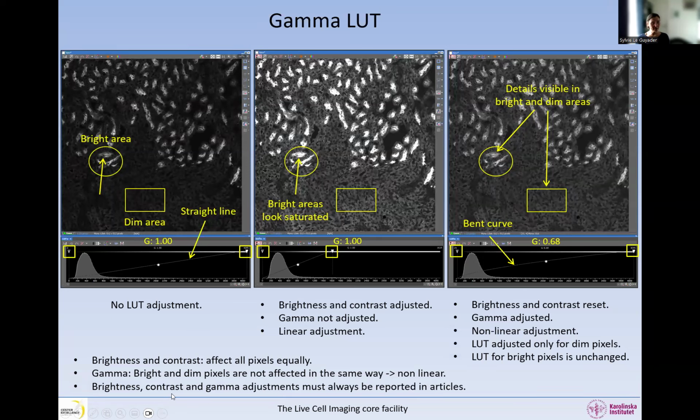So brightness, gamma, and contrast adjustments, it's no problem doing them, but you must report them. It's very important that you do not show an image like this and not say anything, because then people are going to think that this intensity is actually much closer to this one than it is in reality, and that's not okay.